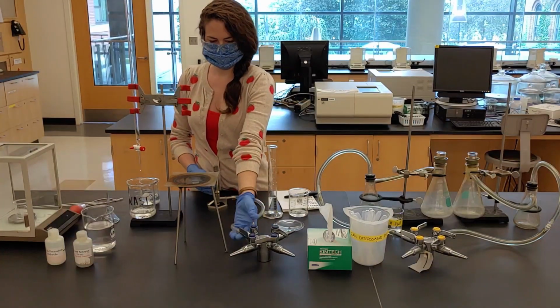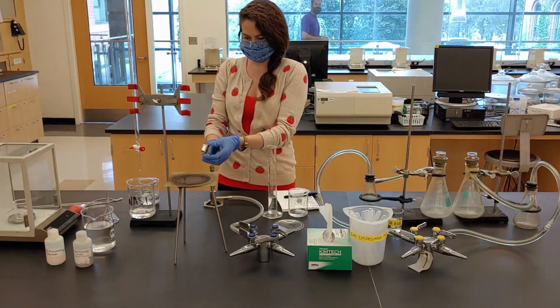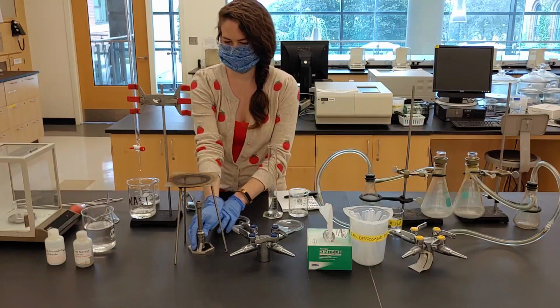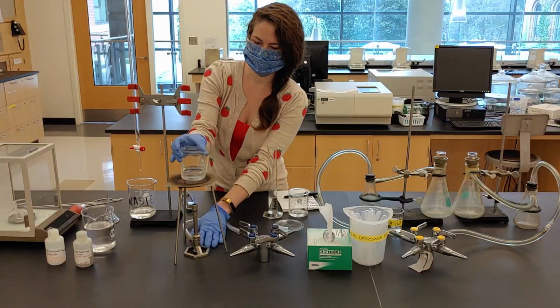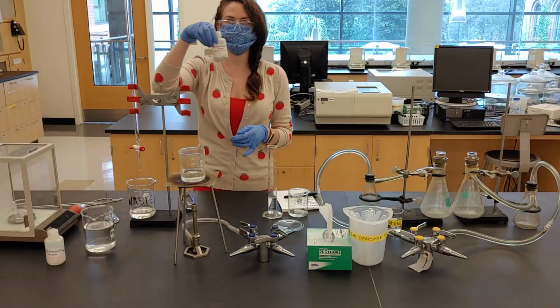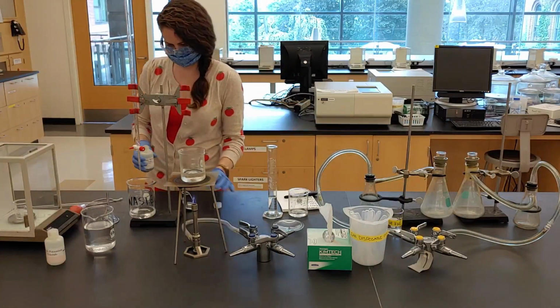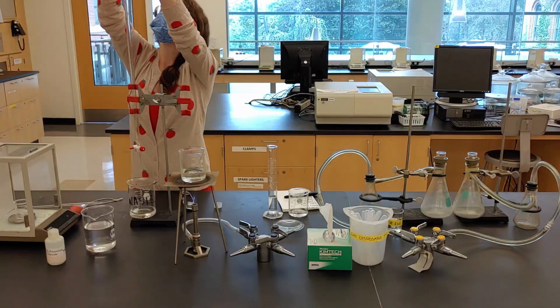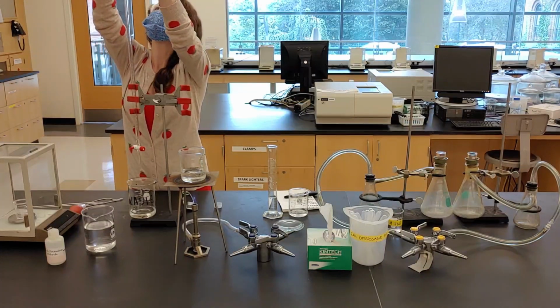Turn the gas all the way on and with the spark lighter, carefully light the Bunsen burner. Place the Bunsen burner under the tripod and the reaction beaker above it on the wire gauze. While waiting for the solution to boil, we can prepare the burette, which will dispense the silver nitrate.